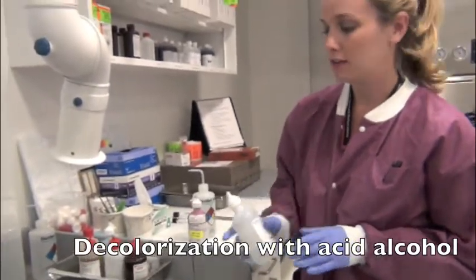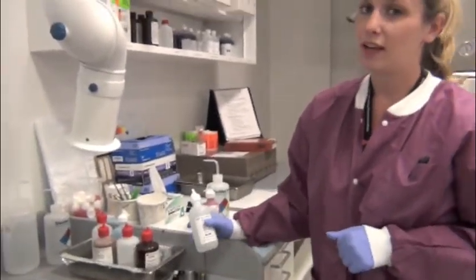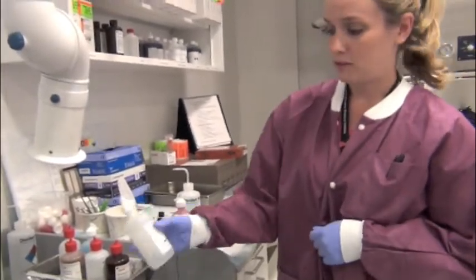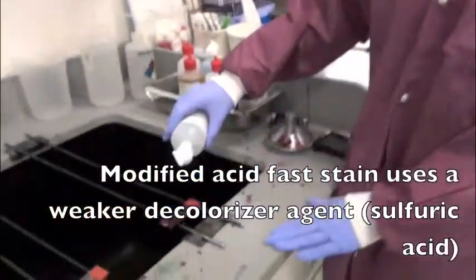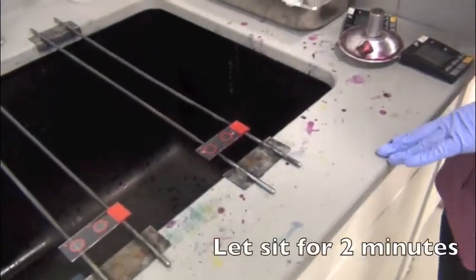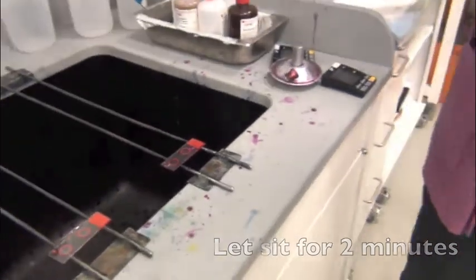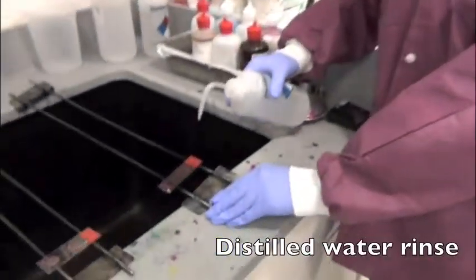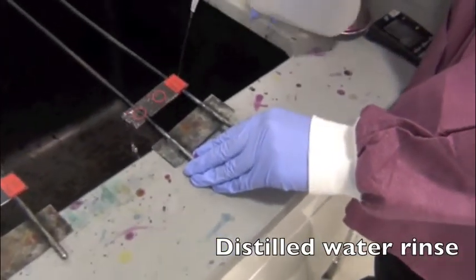It's acid alcohol. Acid-fast bacilli cannot be decolorized by acid alcohol, so that's why we use it. It's a very strong decolorizer. So once again, we pour on the decolorizer, and that stays for 2 minutes. After you've decolorized for 2 minutes, rinse with distilled water like before, gently around the edges. Careful not to remove any specimen.